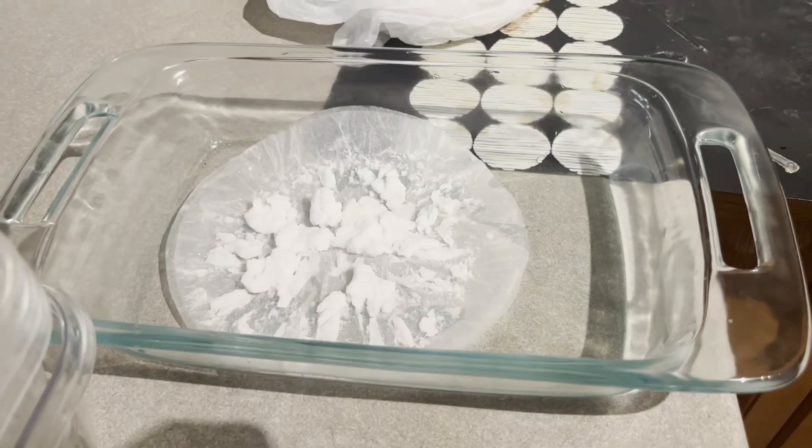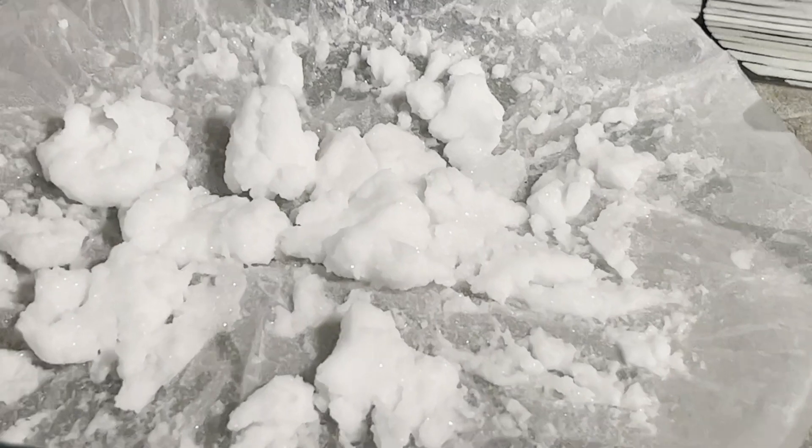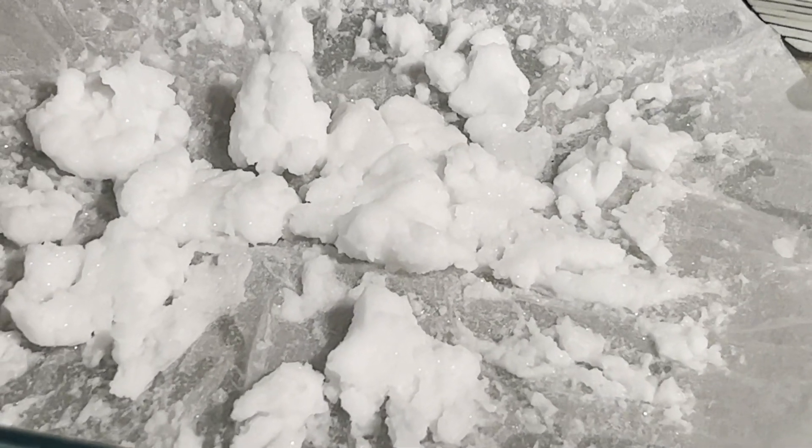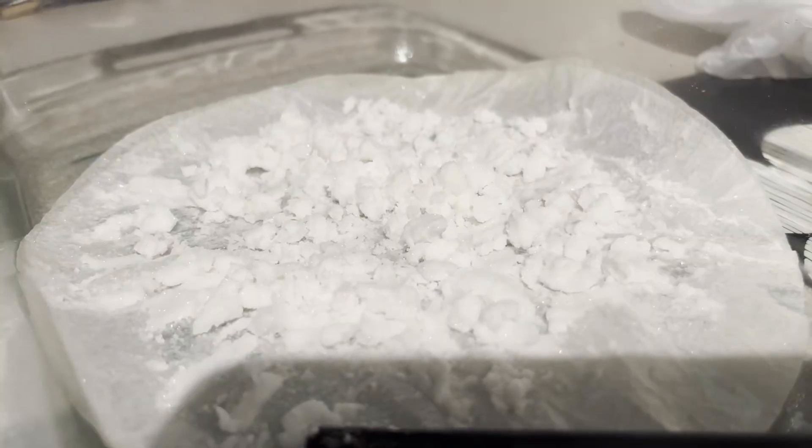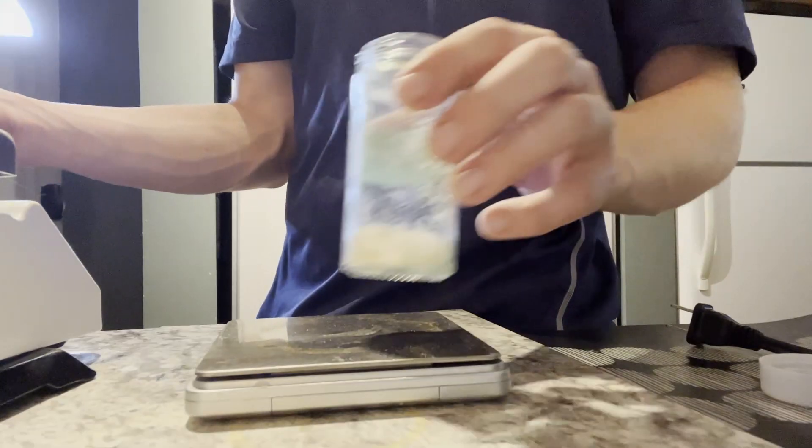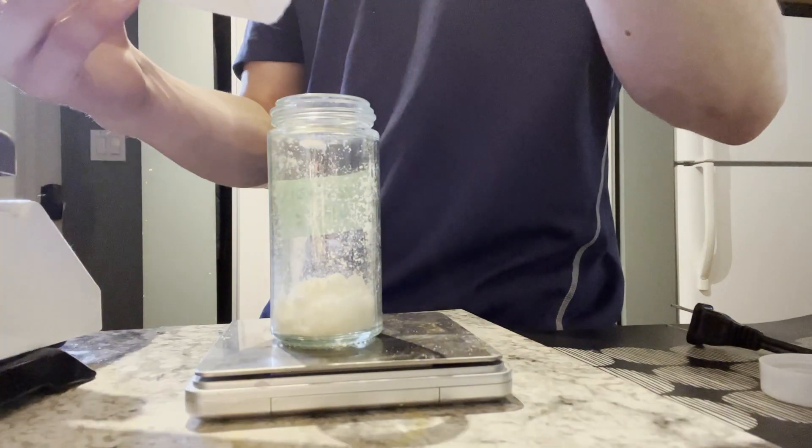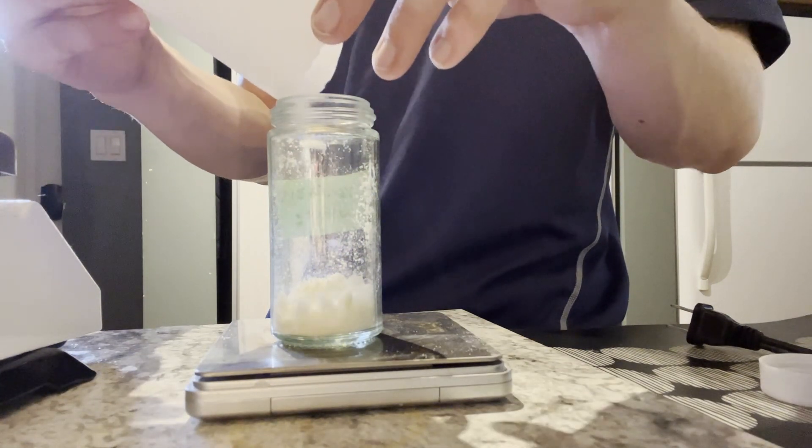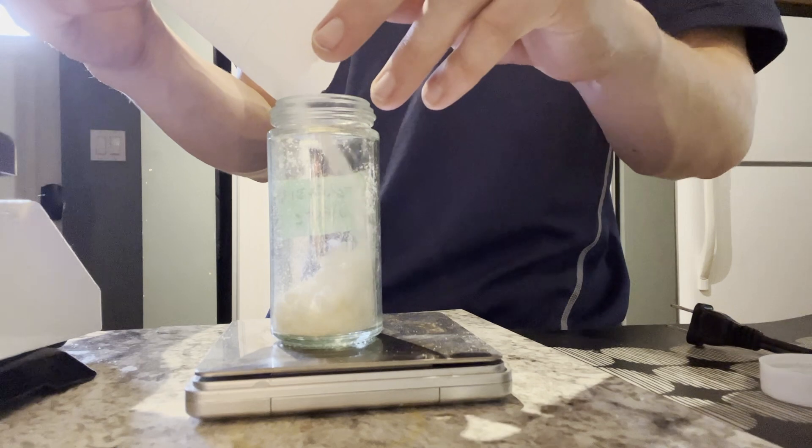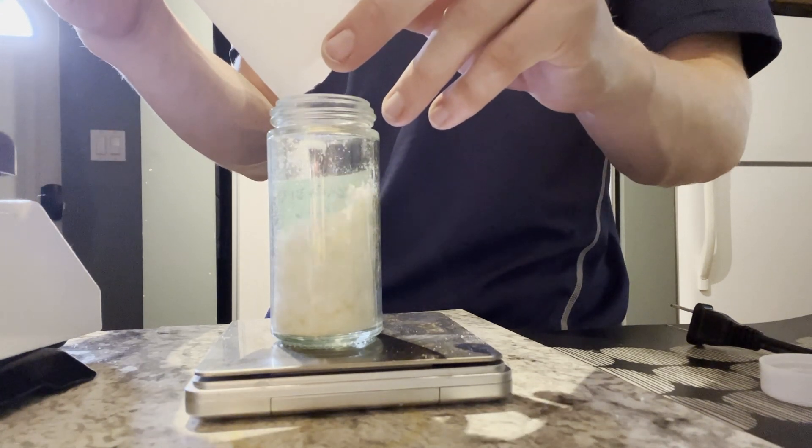All right now I just add it to some old hydrazine sulfate that I made. The old one's a little bit yellow, the new one's white, but I'm just going to purify them both after this and I'll show you that once it's all added and I count my yield.